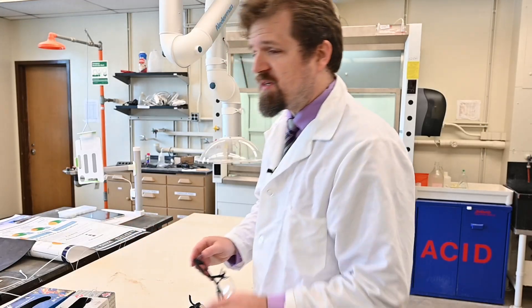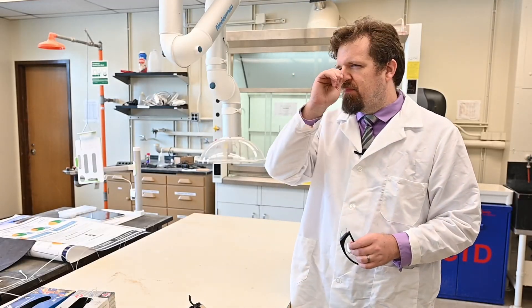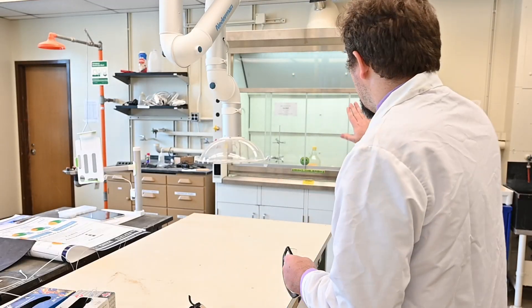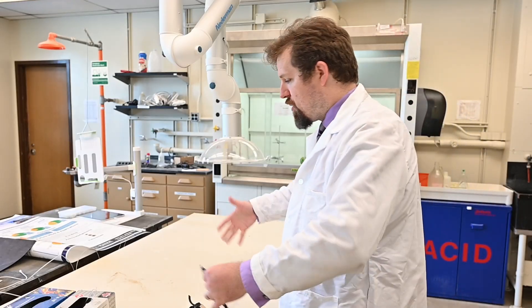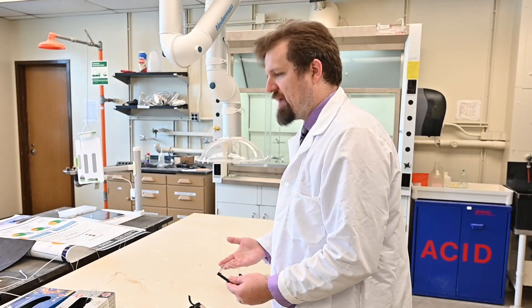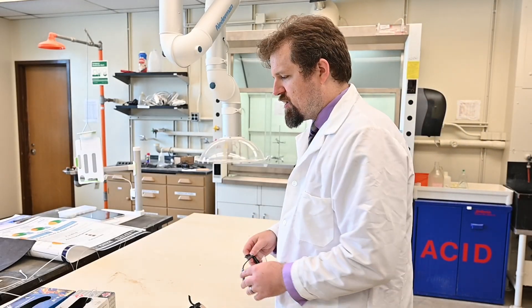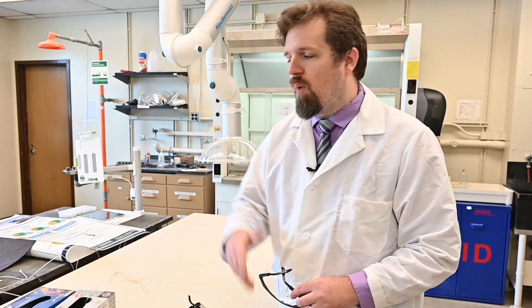Sometimes in the lab you might be dealing with something that's not noxious enough to need a fume hood, and you might just be at a normal lab table. In that case, you might want to use a procedure called wafting.